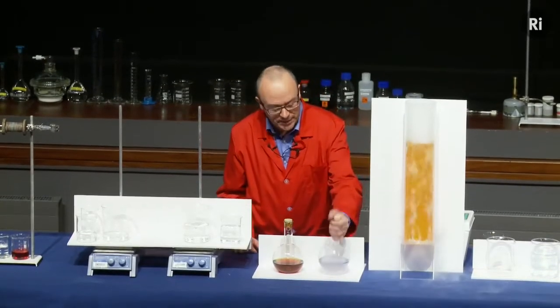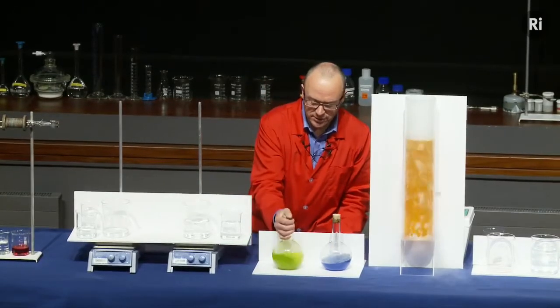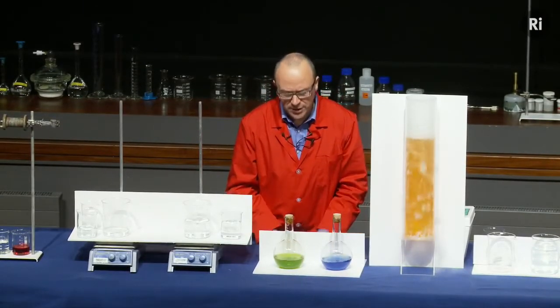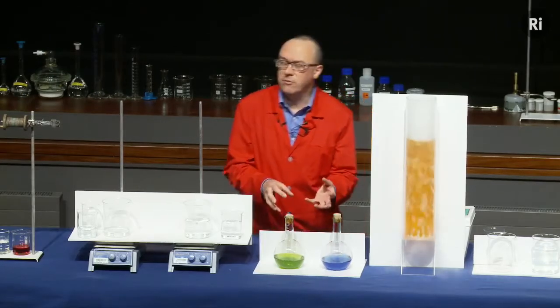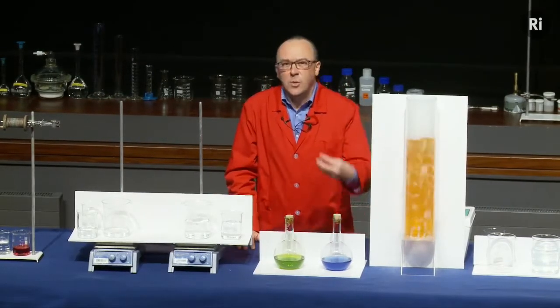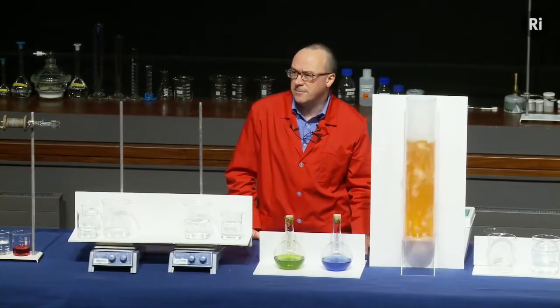So it's going back through that sequence of colours again. And what's more, I can even repeat it. So if I shake it again, it goes back to being blue. If I shake this again, it goes back to being red, and so on. And if I wait, it will go back. So again, it looks as if we have a chemical reaction that's going backwards. But the first mystery is, why do we have a colour change at all? I didn't seem to be mixing two things together.